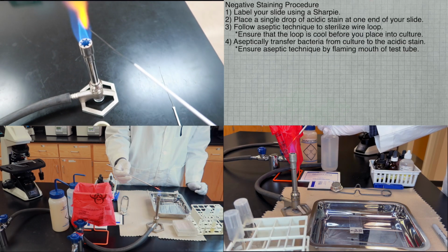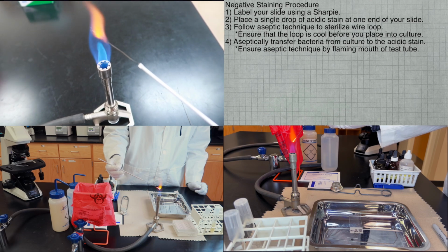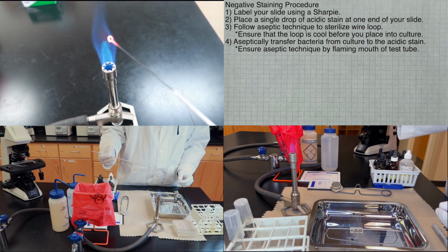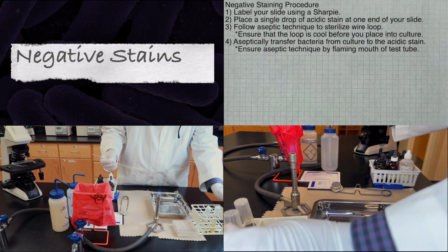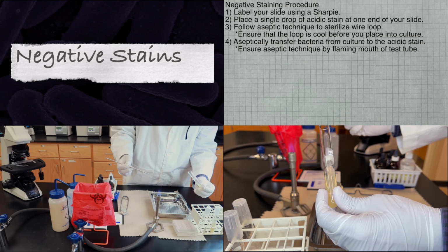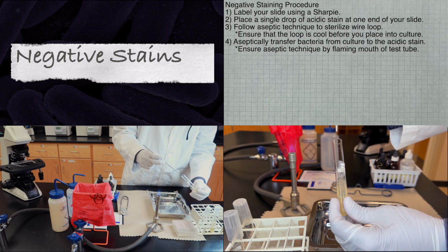Next, please follow aseptic technique to sterilize your inoculating loop, as you have previously learned in the class and as is being demonstrated here. Next, following aseptic technique, please flame the mouth of your test tube, and then, when your loop has been cooled, aseptically transfer bacteria from the culture to the acidic stain on the slide.